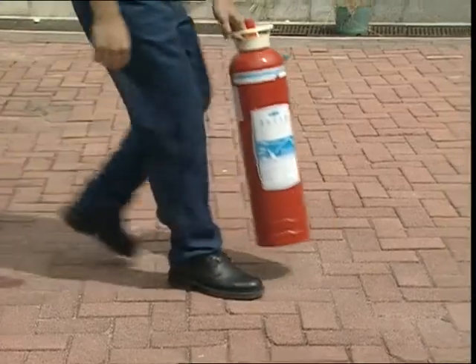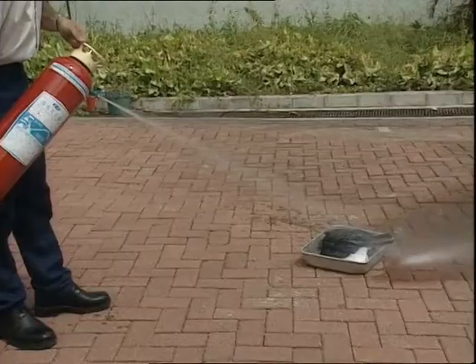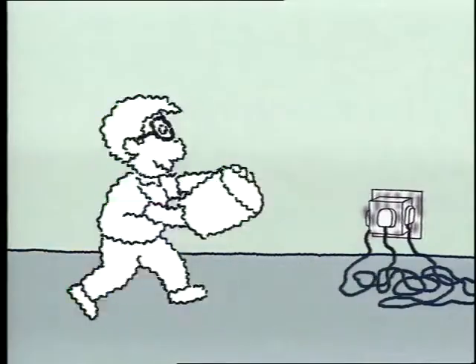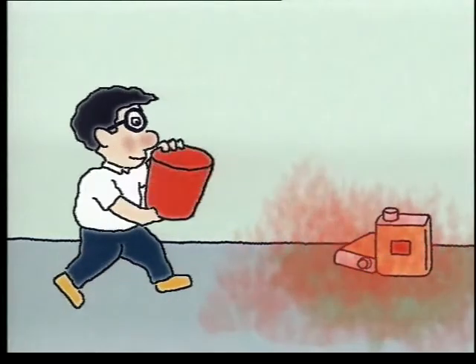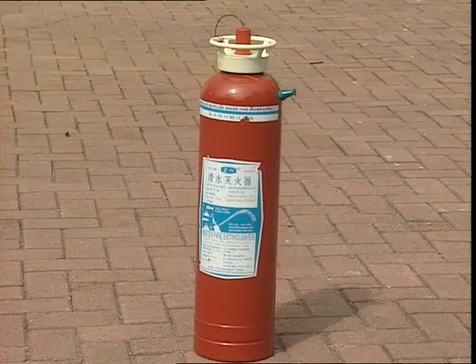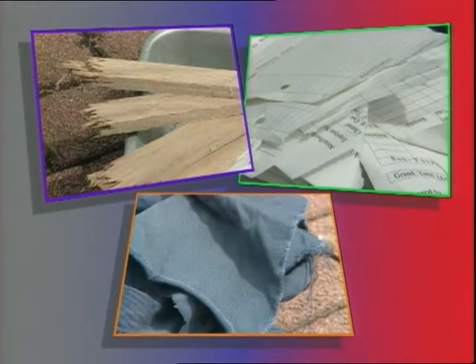When using the water-type fire extinguisher, we have to pull out the safety pin first, then press the handle and aim the jet of water at the bottom of the fire. However, water may cause electric shocks and may induce serious chemical reactions when mixed with certain chemical substances. It can also increase the intensity of the fire if it is used on fires caused by flammable liquids. Therefore, this type of fire extinguisher is only recommended for putting out fires caused by wood, paper, cloth and plastic.